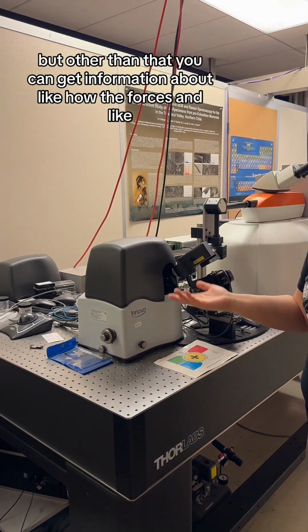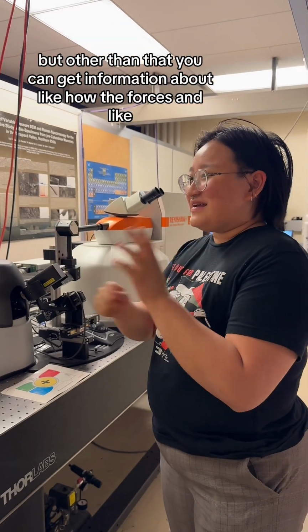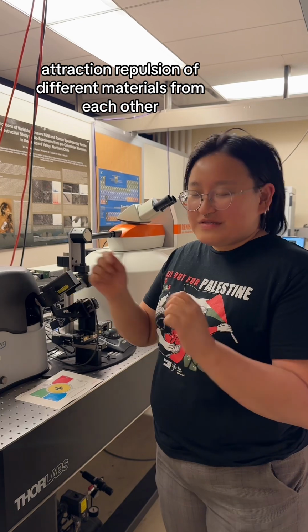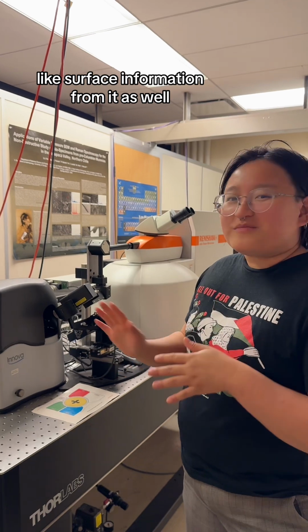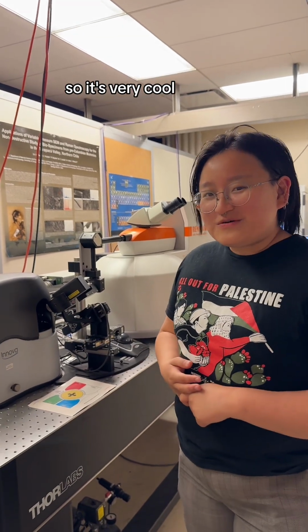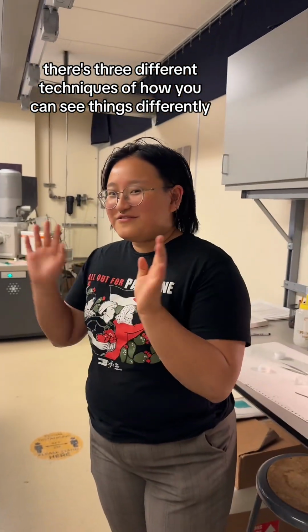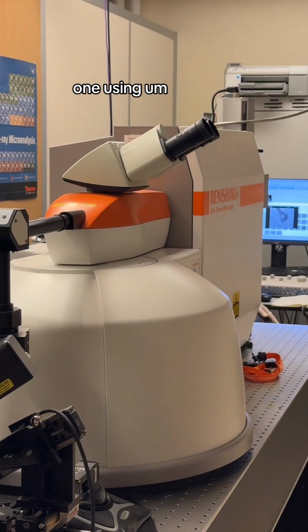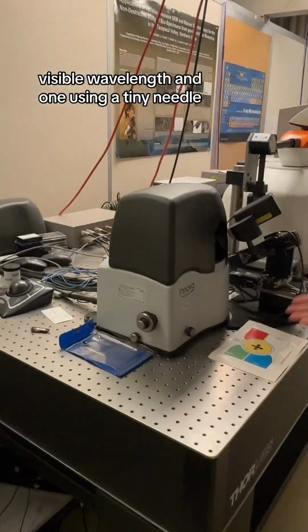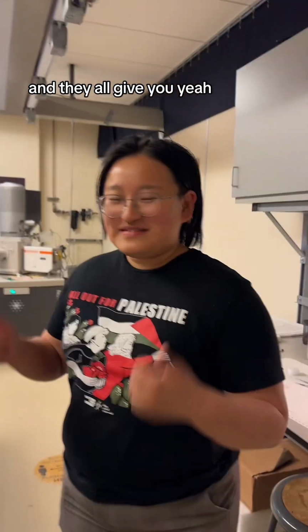Other than that, you can get information about the forces, like the attraction and repulsion of different materials from each other, and you can get surface information as well. So it's very cool. There are 3 different techniques for seeing things differently: one using electrons, one using visible wavelength, and one using a tiny needle, and they all give you similar information.